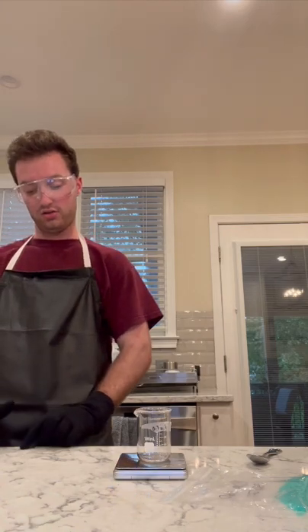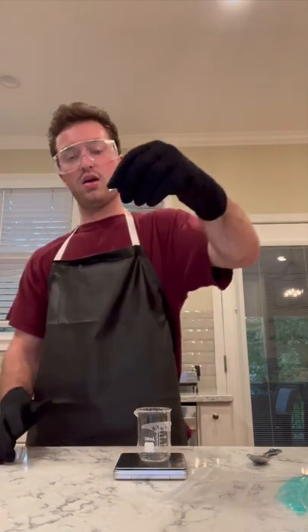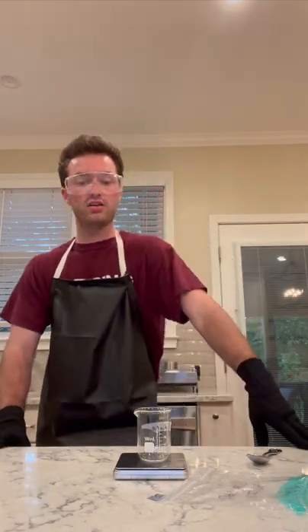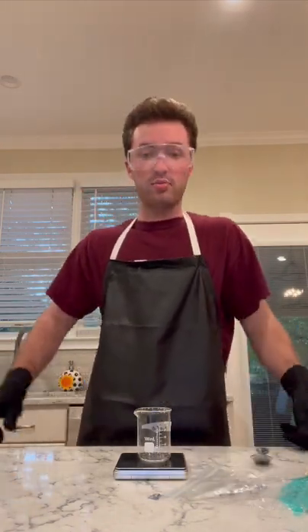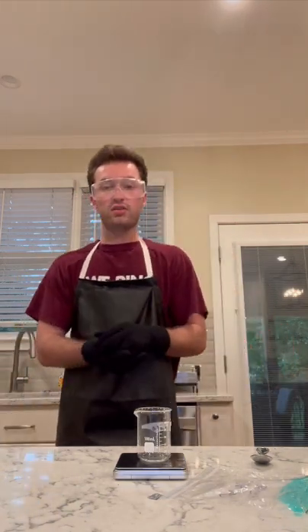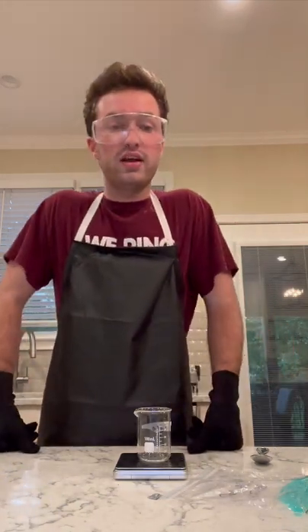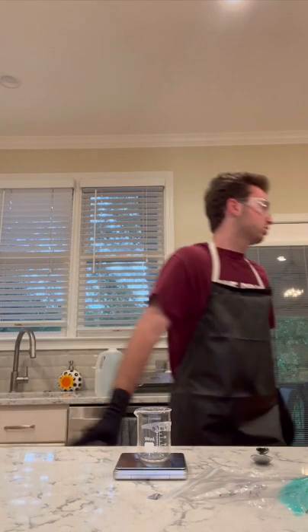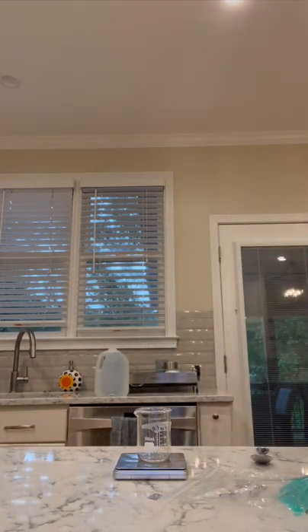And then I also need to use, if I can pick it up, oh, I just dropped it. But anyways, it's a 2x2 piece of aluminum foil that I had prepared from my introductory video. So if you're wondering why there is no video for part 3, that is why; the preparations have already been prepared, so to speak. And excuse me just for a second while I grab some more aluminum foil.